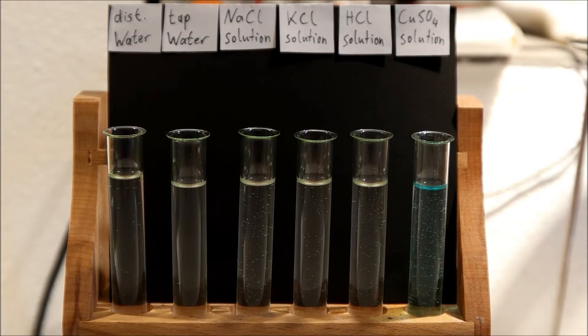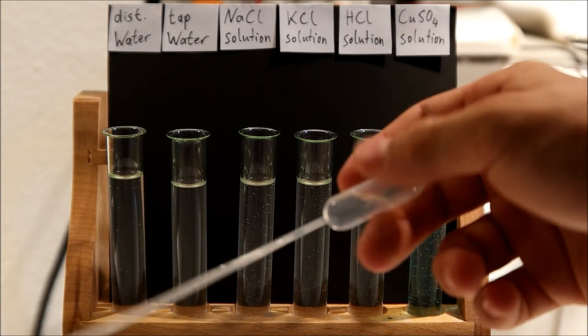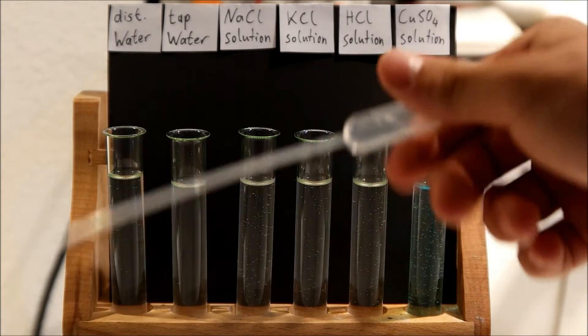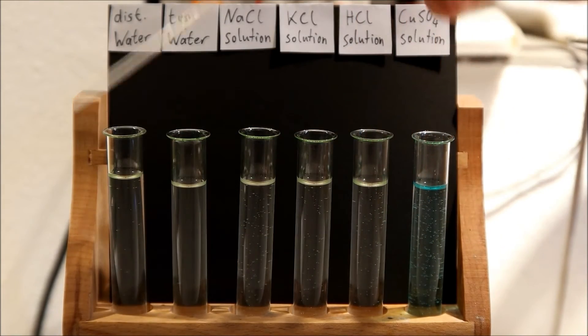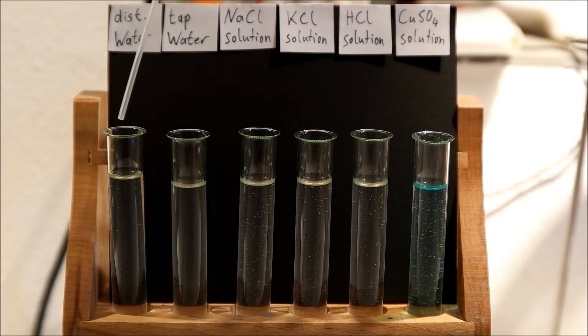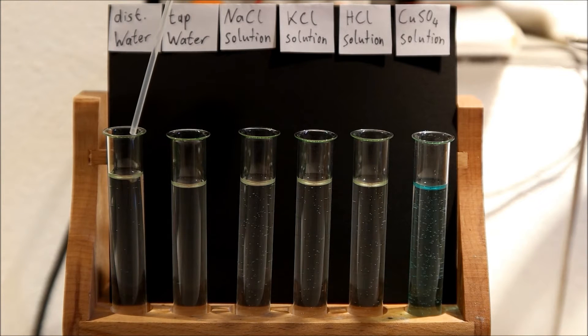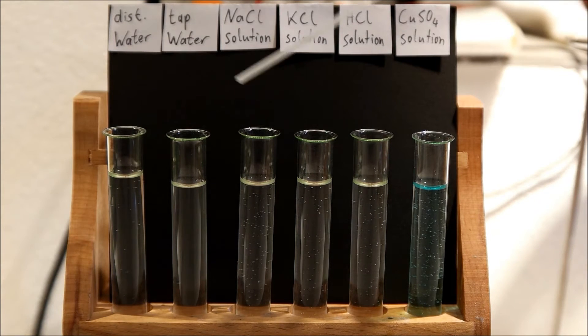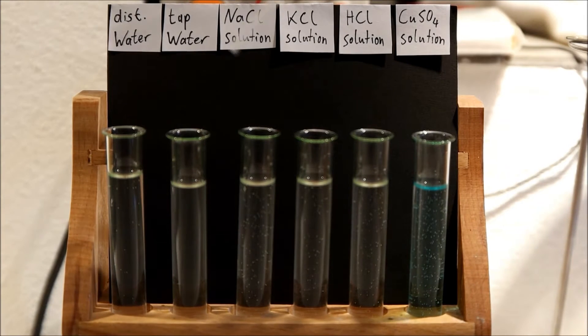Now the first thing I'm going to try is to put a bit of the silver nitrate solution, which I have here, a few drops in the distilled water, and you can see that nothing happens. So there is no precipitation.